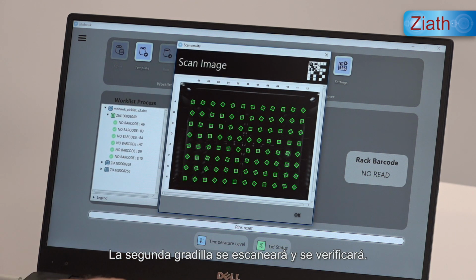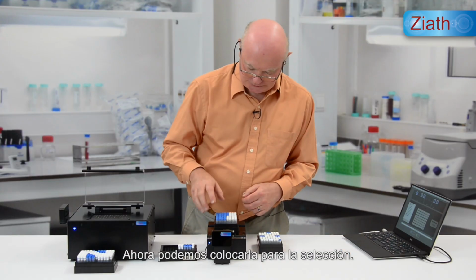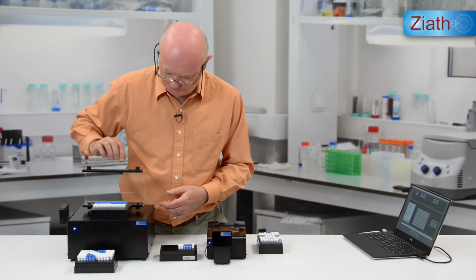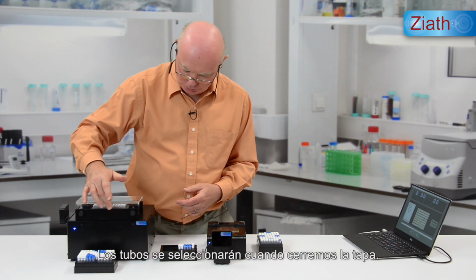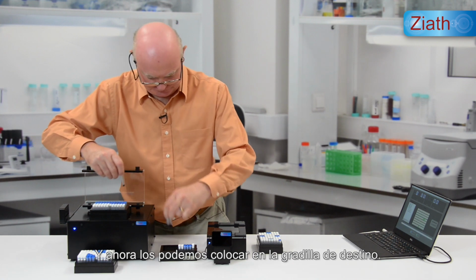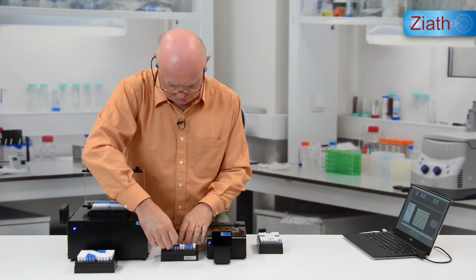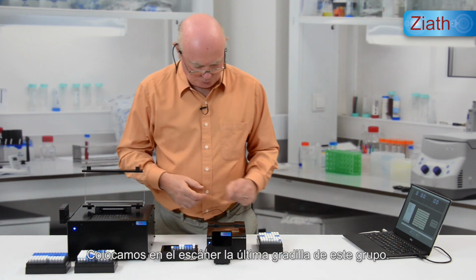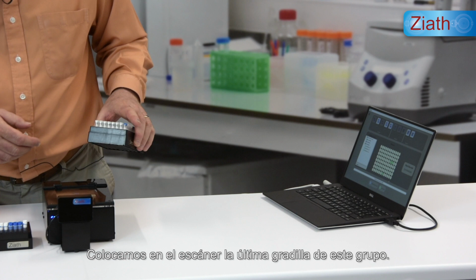The second rack is scanned and verified, and it can now be placed for picking. When we close the lid, the tubes will be picked. We can add them to the destination rack. And move on to the final rack from this group.